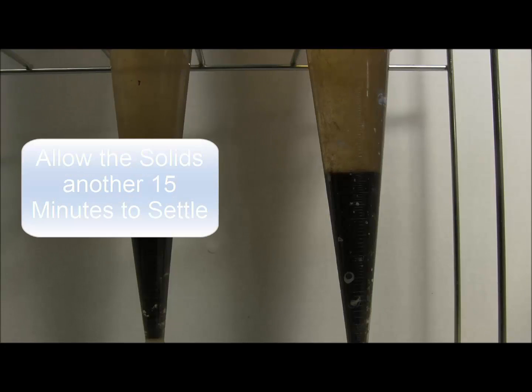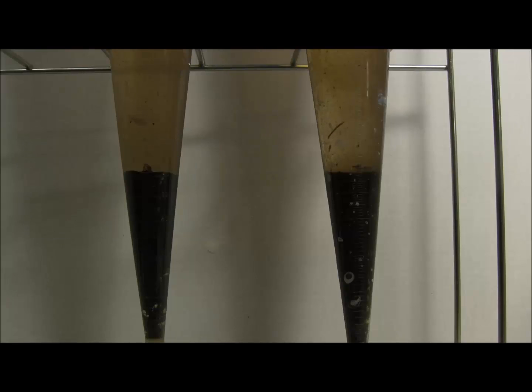Allow the sample to settle for an additional 15 minutes after you've stirred or rotated the Imhoff cone.